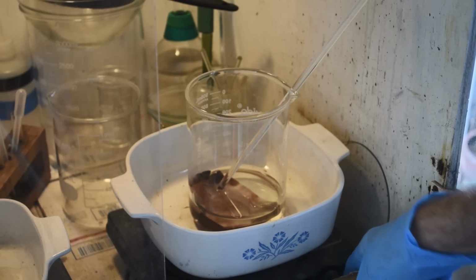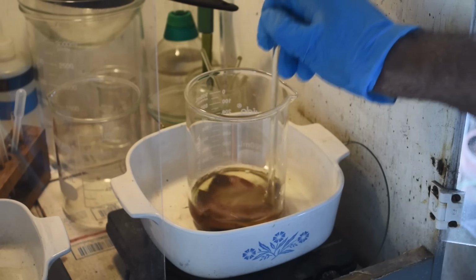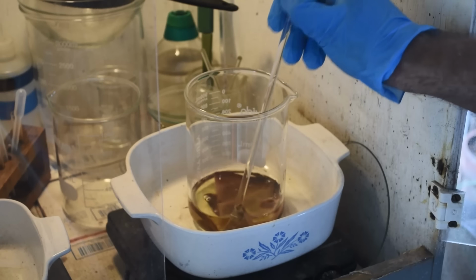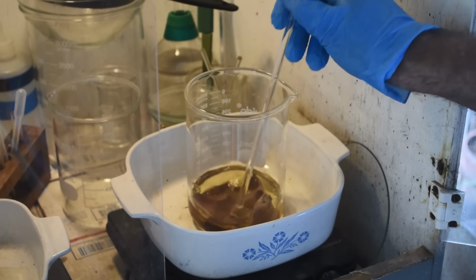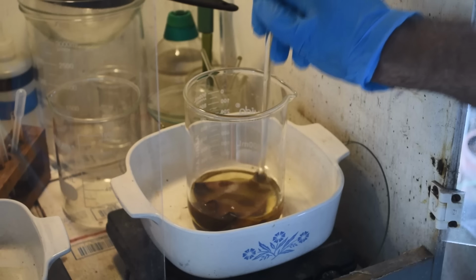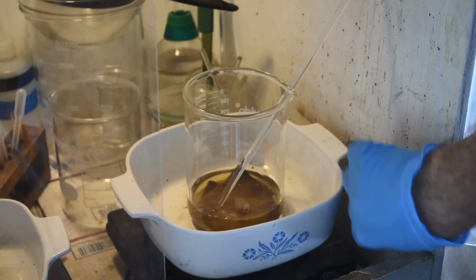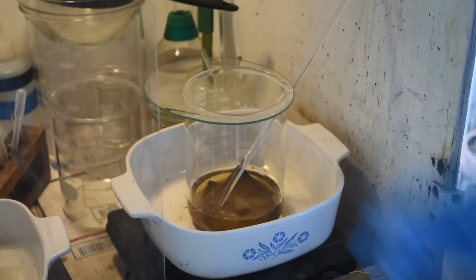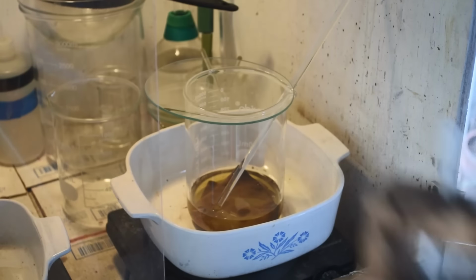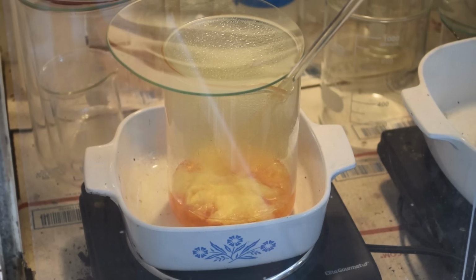I'm going to put a little bit of heat to it. Give it a stir here. I suspect that dark color is iodine coming out of solution, but I don't know for certain. Let's see if there's any gold in this. We'll let it sit and simmer for a bit, and we'll give it a stannous chloride test. I may have put a bit too much heat to it too quick. It started boiling, but look at that. The aqua regia has bleached whatever that color was. I assume iodine right out of the paper in there.